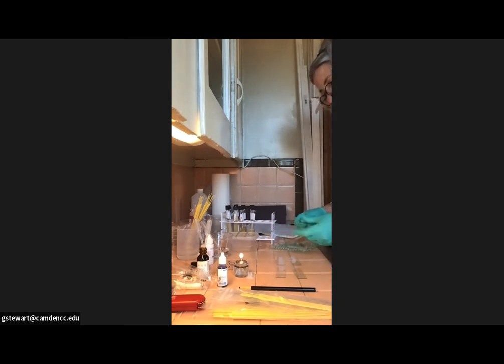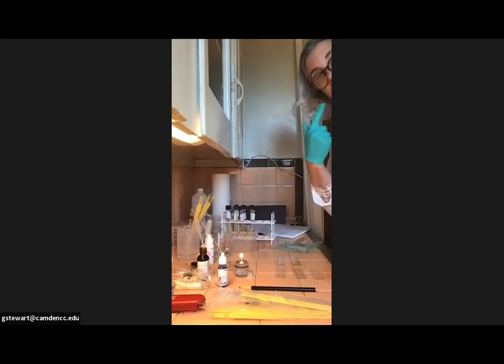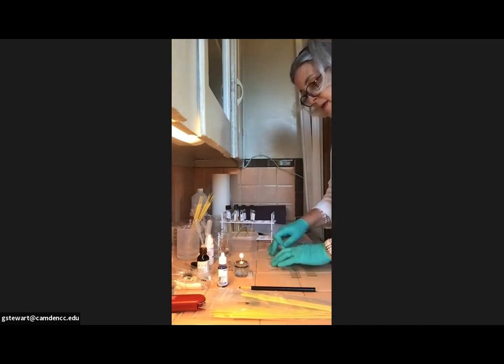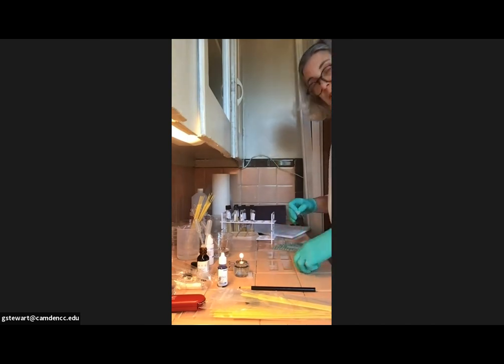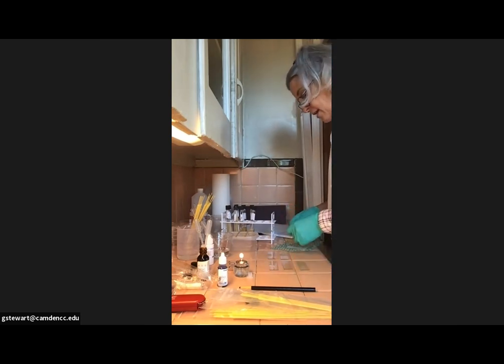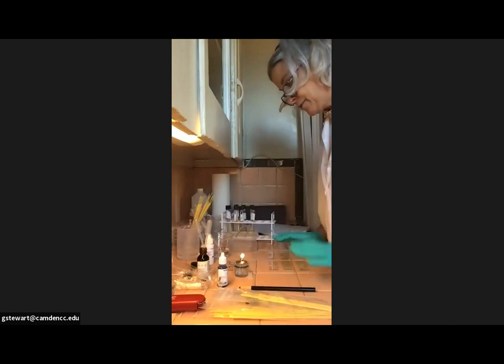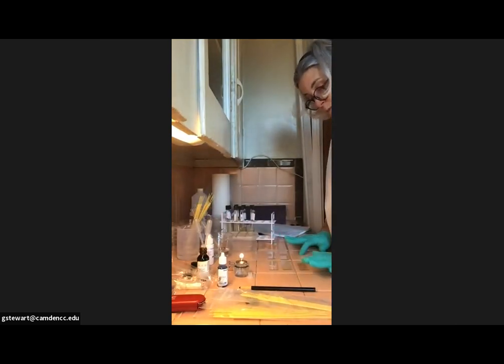And the last slide, slide number 5, is going to be a tooth and gum scraping. So we're actually going to set up 5 slides. And I realize in your lab booklet, they make this 5th slide a whole other activity. Our lab kit did not include a pre-gram stained prepared slide for you. So you're only going to have 5. If it included that extra slide, it would be here. It would already be stained.